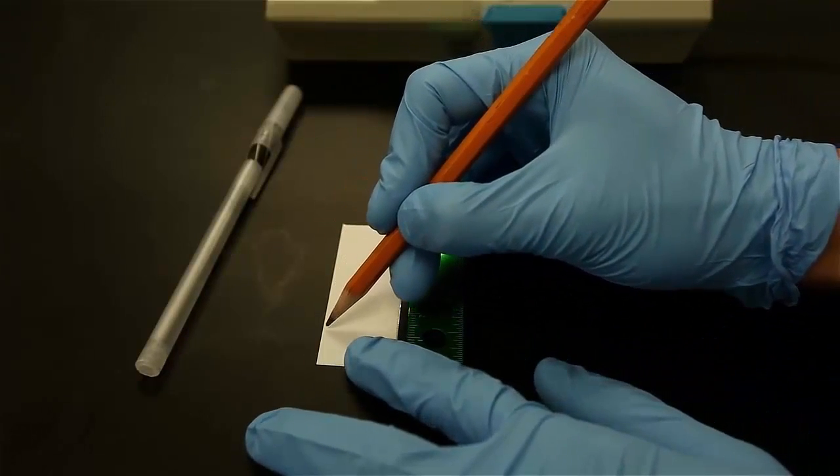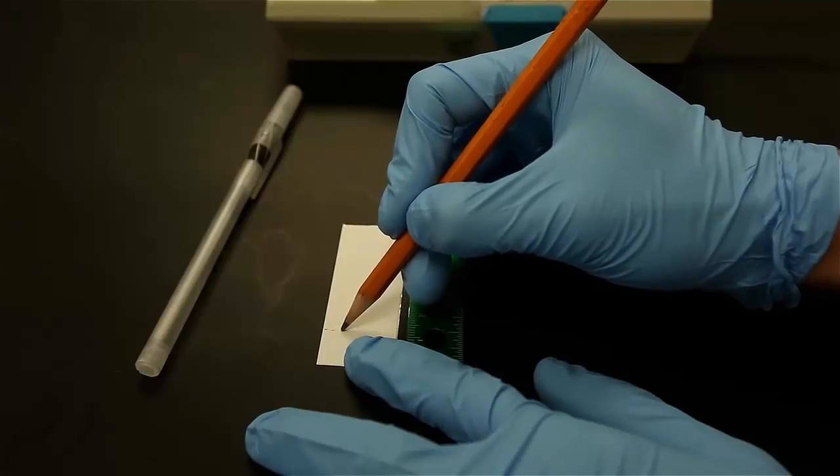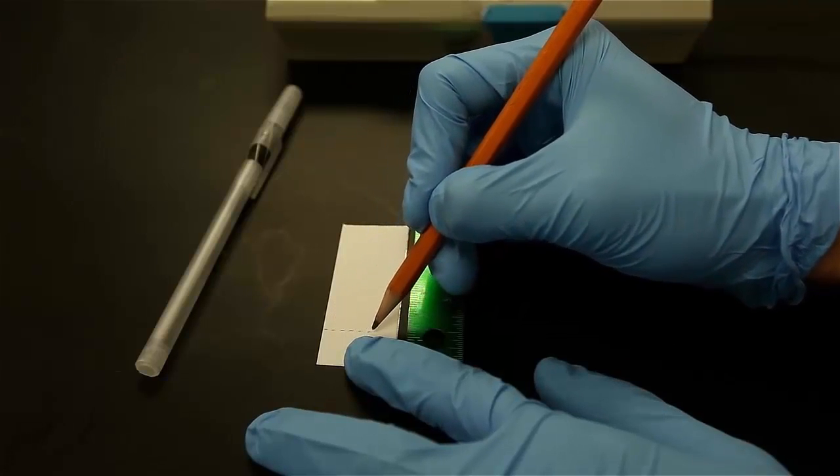Your origin should not be lower than the eluent in the jar, because the sample will likely be dissolved in the eluent.